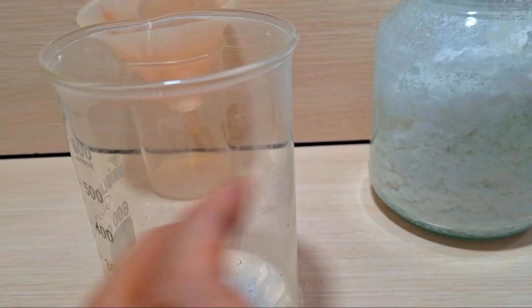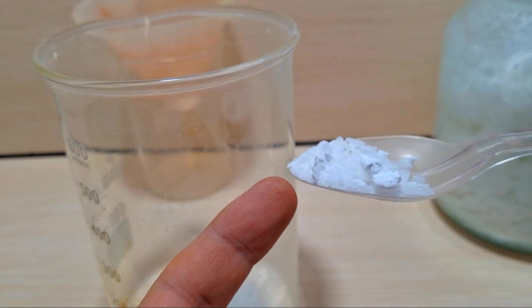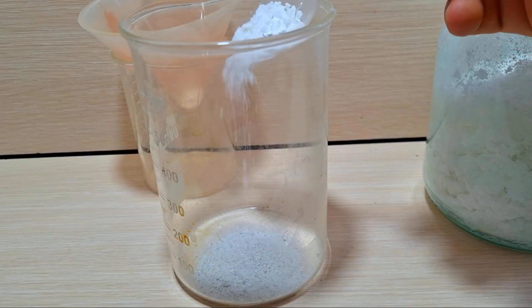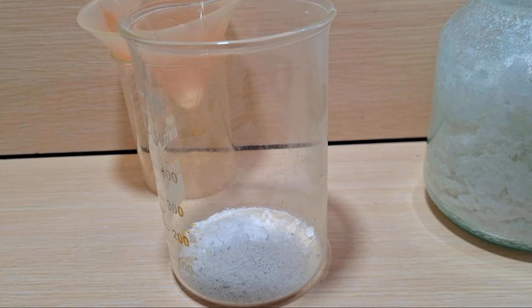For the experiment, I need a small amount of sodium hydroxide. It shouldn't be too much because it may cause the lithium to precipitate as impure white crystals, ruining the results. Sodium hydroxide is harmful to breathe in and can be damaging to the skin and eyes, so be cautious.